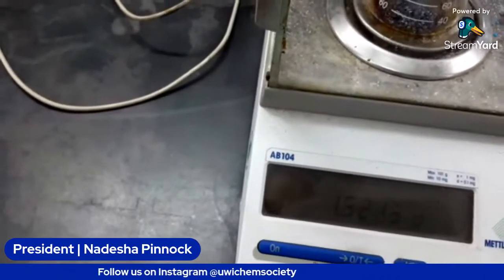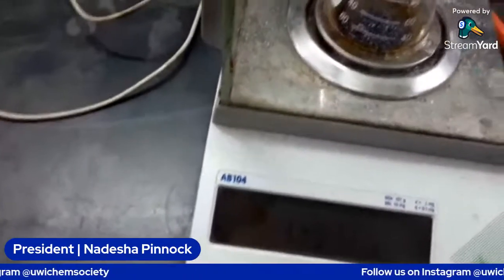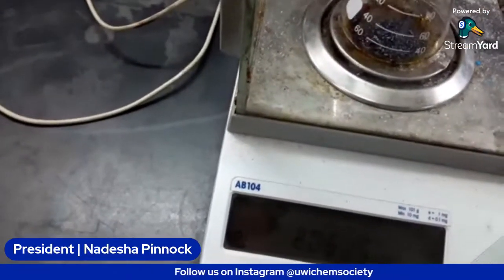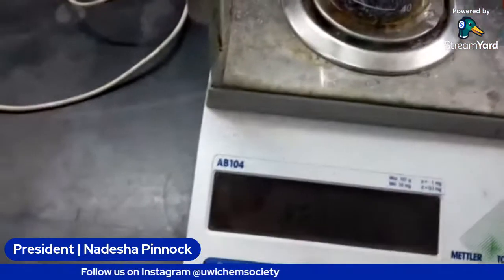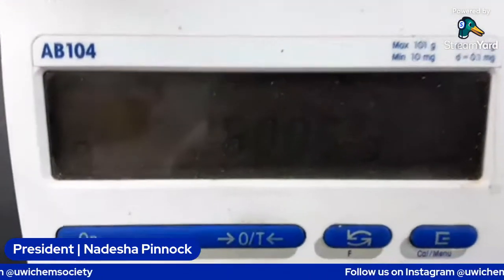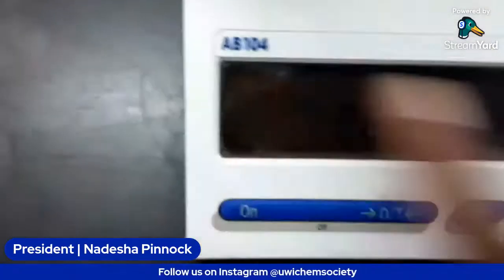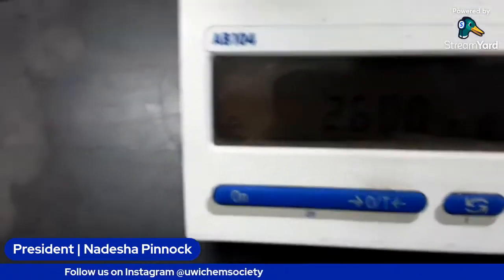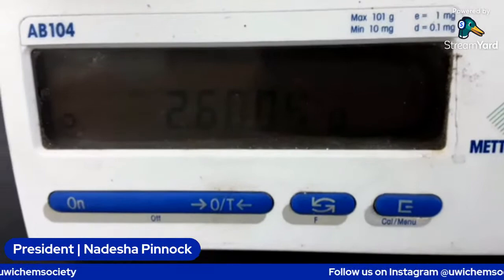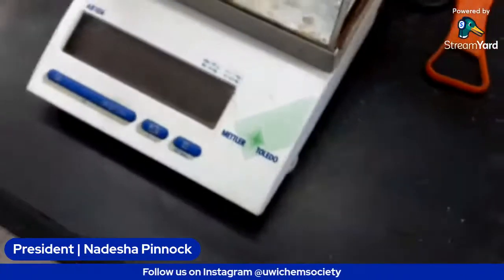All right, so while I'm weighing out this to make the Lugol's reagent, Tiffany is currently reconducting the Benedict test. So we actually have 2.6 grams. Oh Lord, that should be clear. There we go. We have 2.6 grams of iodine. Close enough.